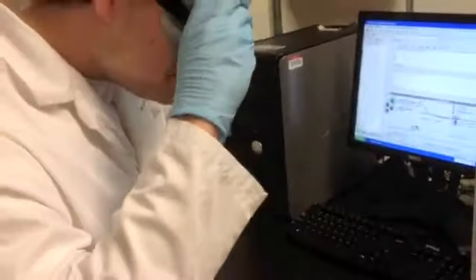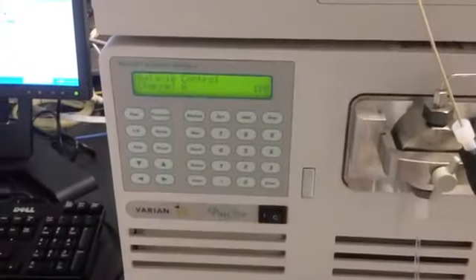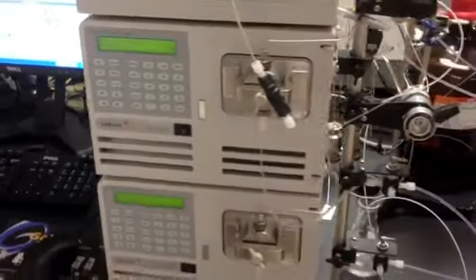At this point, we've got to put on our goggles. This machine will get up to 1600 psi and that's a lot of pressure. It's rising pretty quickly, so we're going to go prepare our sample.